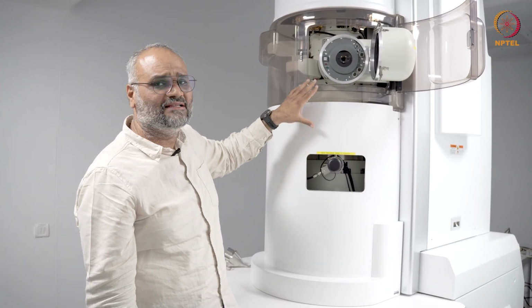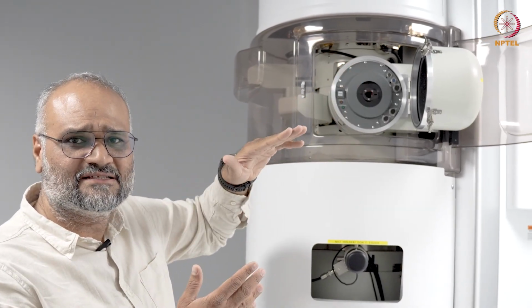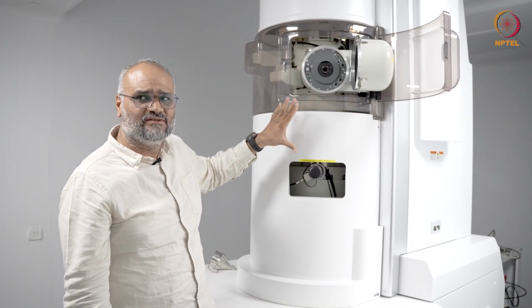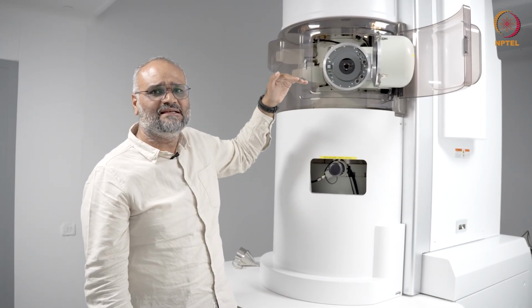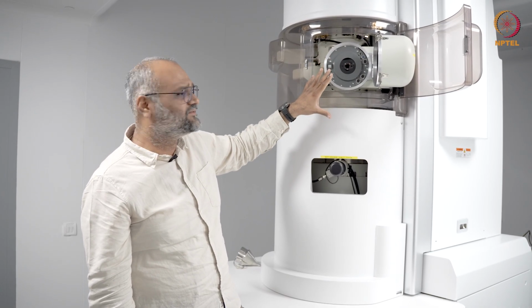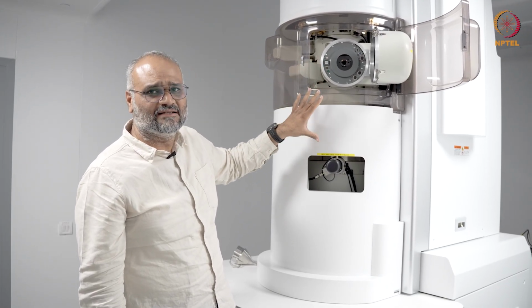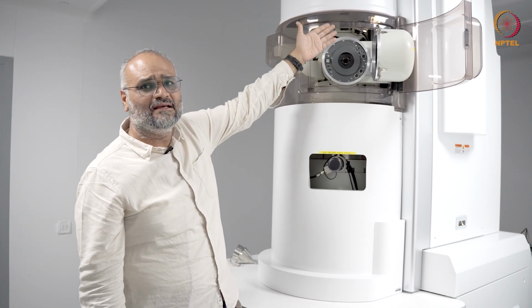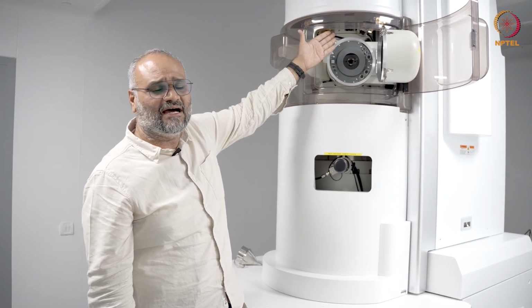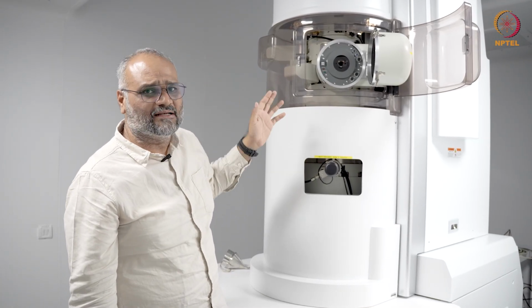So the idea is, in this microscope, the objective lens introduces positive CS, the aberration corrector introduces a negative CS, and collectively you're lowering the CS of the condenser objective lens system depending on where you're placing the corrector. If the same kind of corrector is placed before the goniometer and just after the illumination system, you call it the probe corrector.